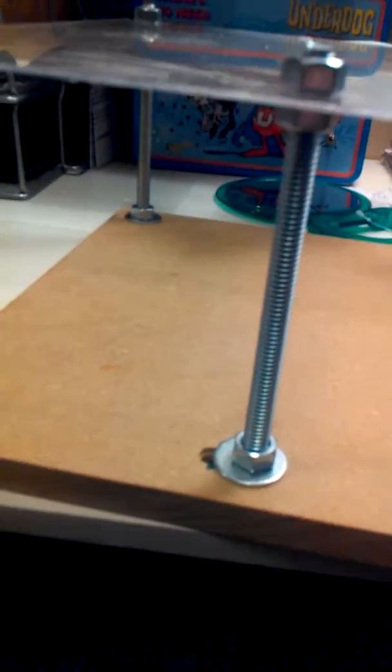And this is what it looks like. Plexiglass, MDF. You can use whatever wood you want with some carriage bolts holding it together.